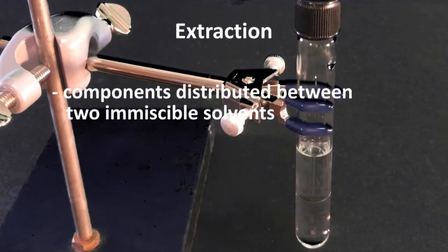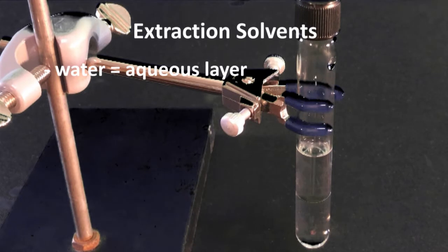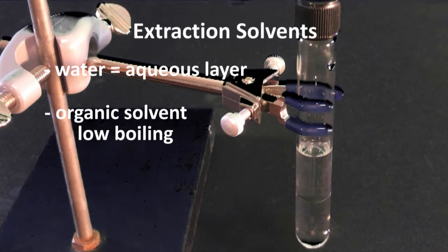In this process, components of a mixture will be distributed between two immiscible solvents. Since these solvents are insoluble in each other, two distinct layers are formed when combined. This is what you would see if you mixed oil and water. Usually water is used as one of the solvents, the aqueous layer. The other is an organic solvent, ideally with a low boiling point, so it is easy to remove after the product has been isolated.